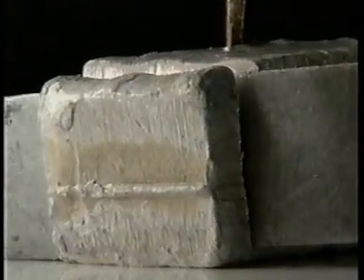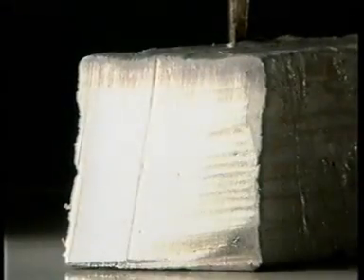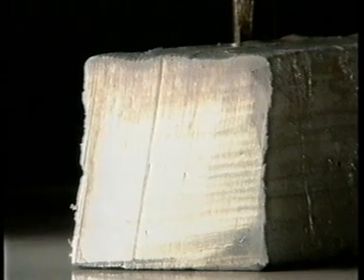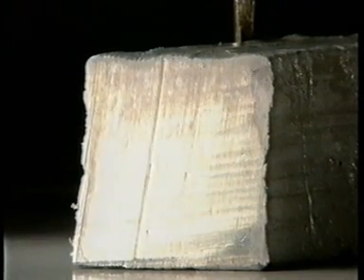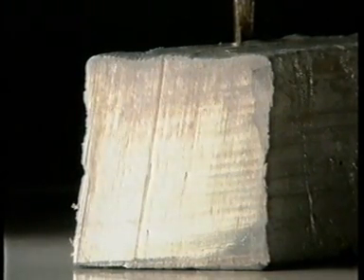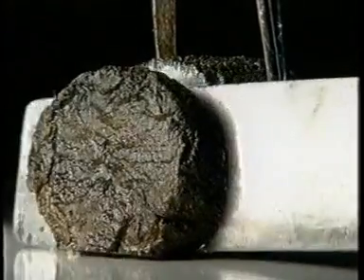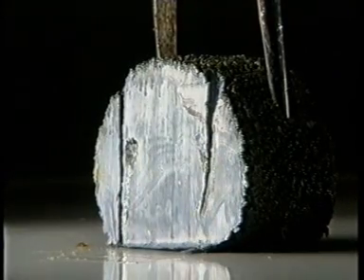This is sodium. It's even easier to cut and again the shiny surface soon discolors. Potassium is even softer and reacts so quickly it tarnishes immediately.